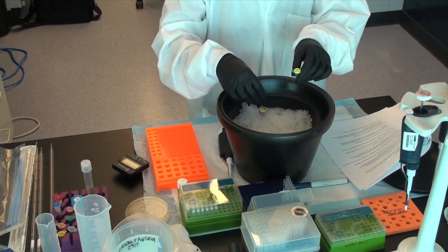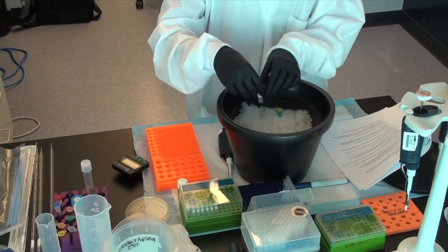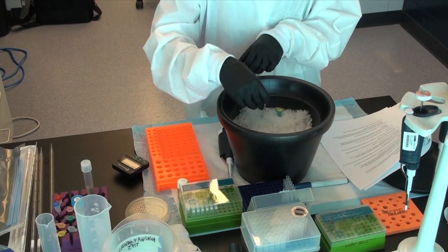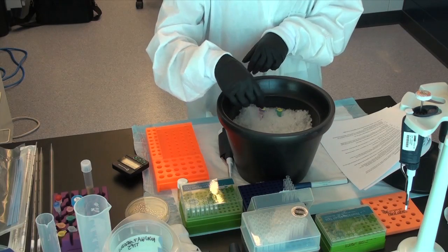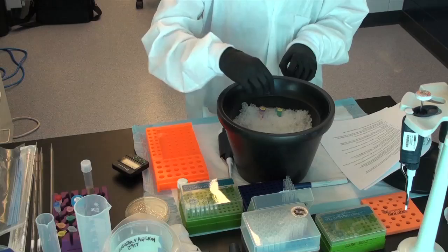Step 5: Thaw one 50 microliter vial of OneShot TOP10 chemically-competent E. coli bacterial cells on ice for each ligation or transformation.